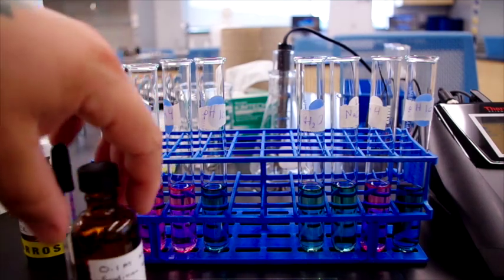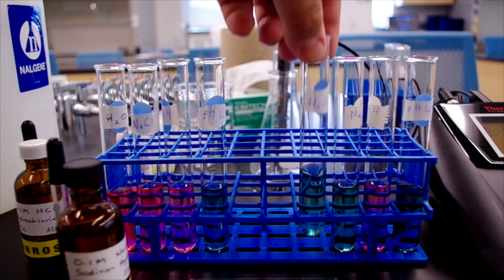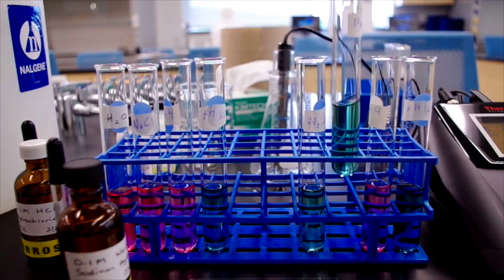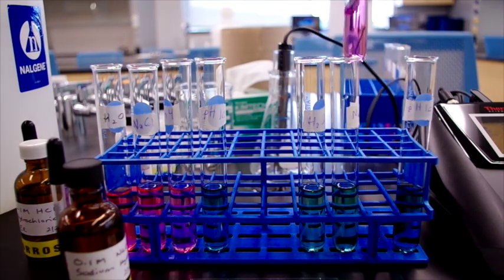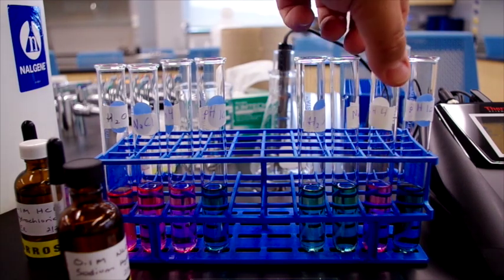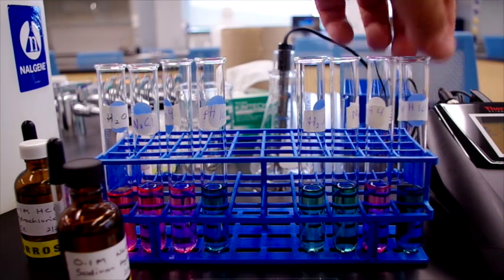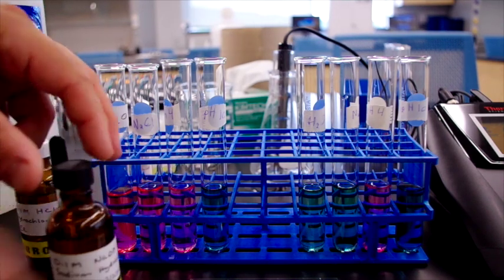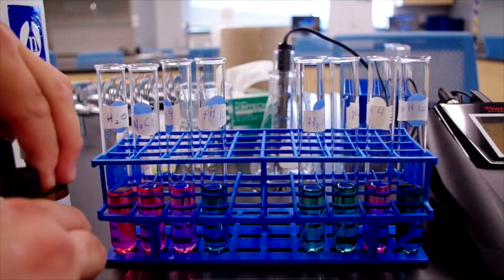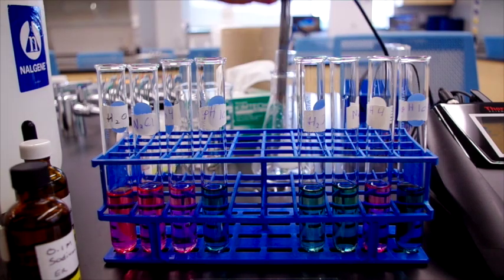And if you'll notice, the first two solutions have basically landed hard on the greenish blue. pH 4 solution is still at pink, and the pH 10 solution is still at bluish green. Now if we were to measure the various pHs of these, we can do that.